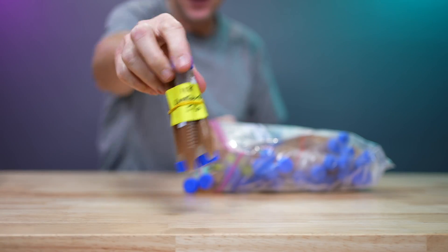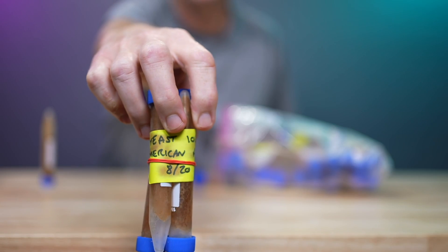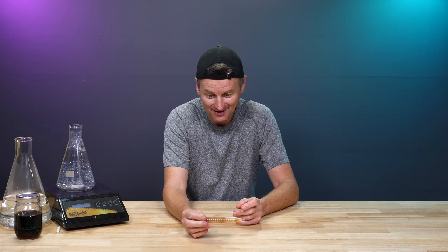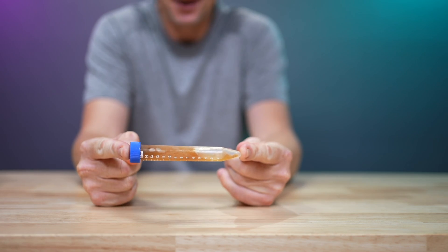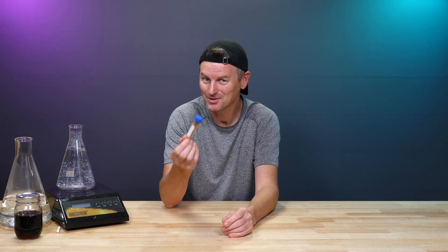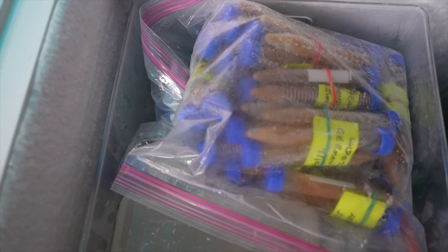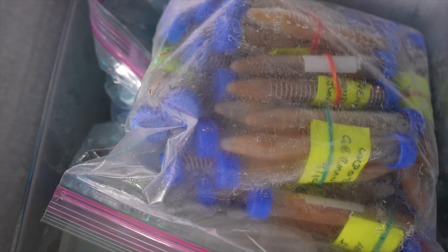Ringwood — this is one of my favorites. And these have been around for a while. 8/20, that's August 2020. Now frozen in here are approximately 20 billion yeast cells. I'm going to show you how to do this step by step — what you need to do to create your own frozen yeast bank. I have 17 different yeast strains in my freezer that have been there for years, and you can do it too.